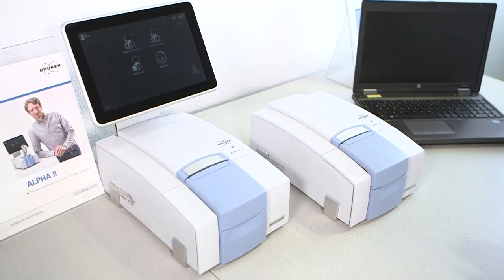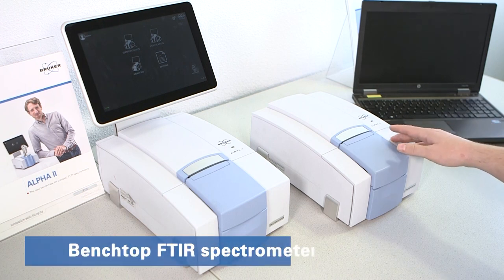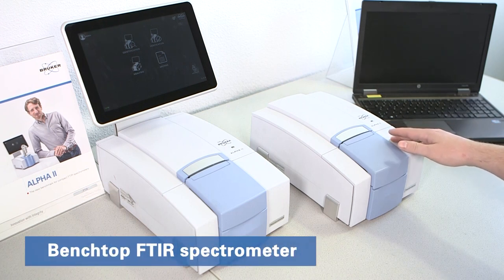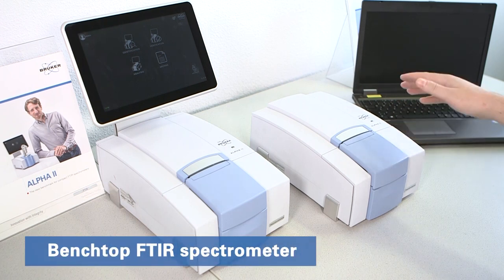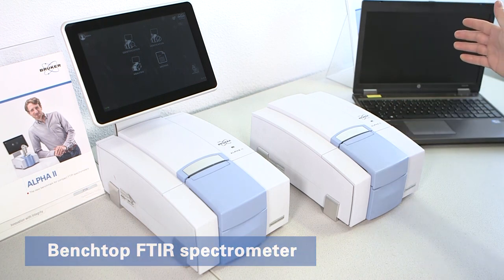FTIR spectrometers come in many shapes and sizes. Conventional FTIR instruments are usually controlled with a laptop or desktop PC.